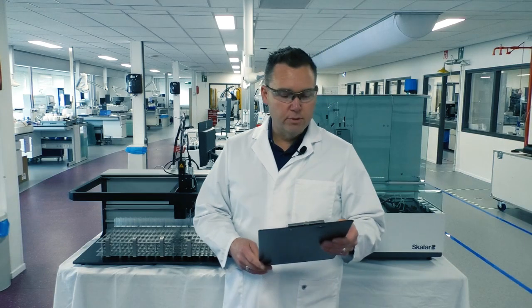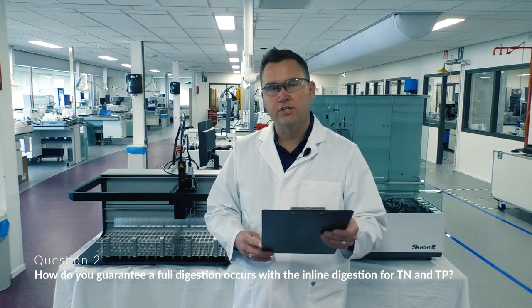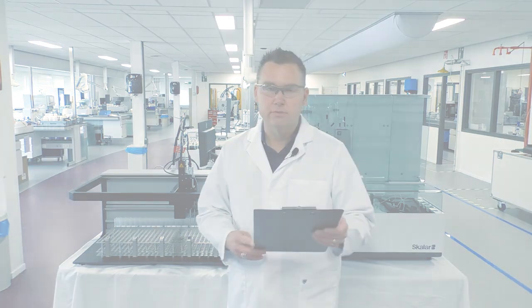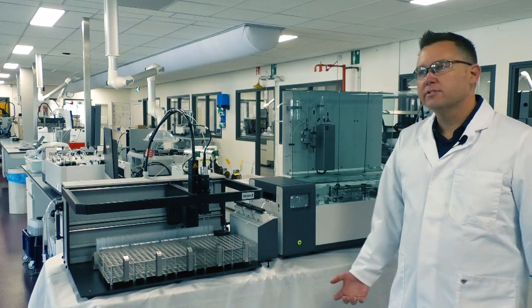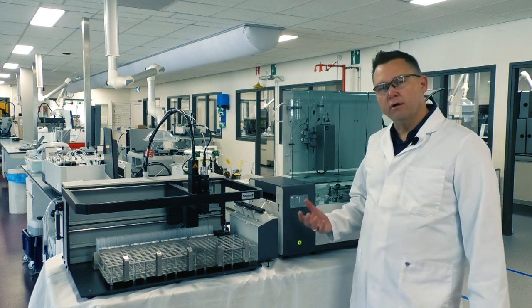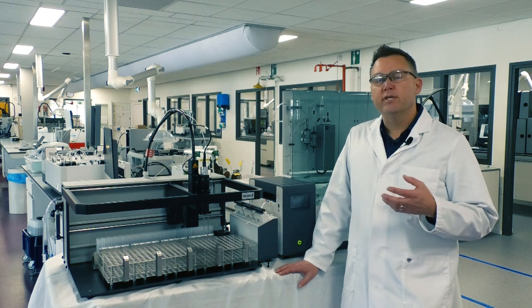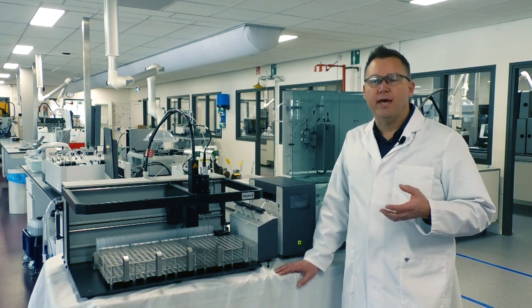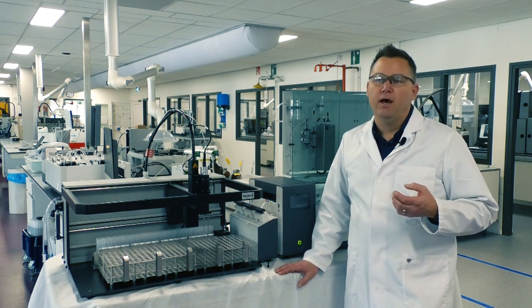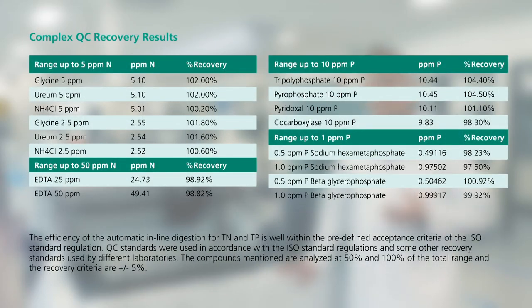On to question number 2. How do you guarantee a full digestion occurs with the inline digestion for total nitrogen and total phosphorus? So this is how we handle the inline digestions on our system. So once the sample is brought over from the auto sampler, it's going into the digestion step. And what we do is we apply a back pressure to that. So we put the system under pressure. That allows us to get the temperature up to 110 degrees C in line without basically popping off tubes. In doing so, we're emulating what we would do on an autoclave.